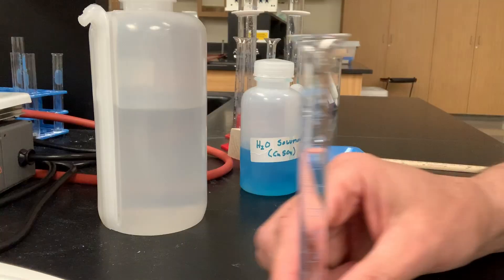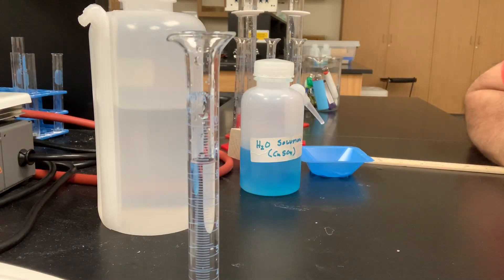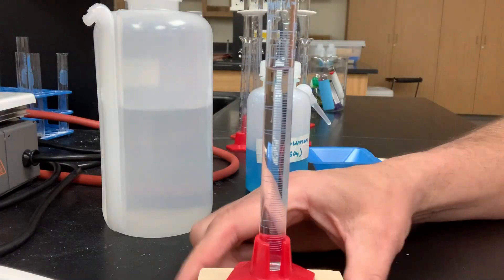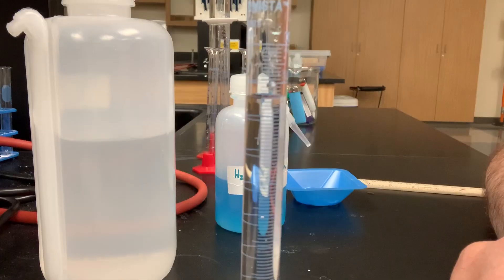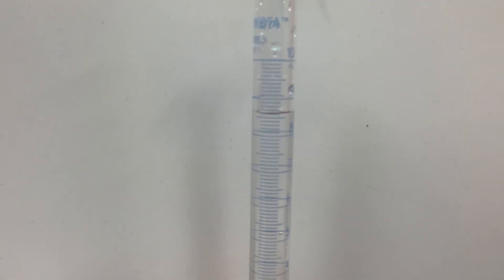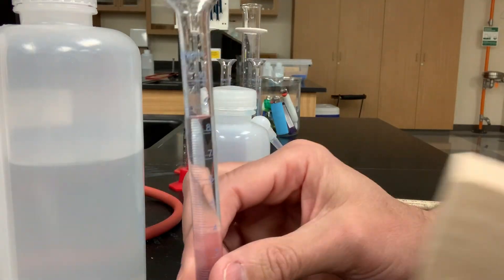Now, of course, the next thing is to find the volume of my distilled water. So, like I said, we can read the graduated cylinder to do that. Now, remember, you're allowed to estimate one digit, so we're going to get nice and close and try to get as level as we possibly can. Let me put this actually up just a little bit for you, so we can maybe get the camera lens level with my meniscus and my graduated cylinder. So, I'm going to put a light background here. It's going to be a lot easier to read that way. So, go ahead and take a look and see if you can read the volume of the liquid in that cylinder. It looks like it's between 8 and 9 milliliters. So, go ahead and take your reading. You can pause the video if you need to.